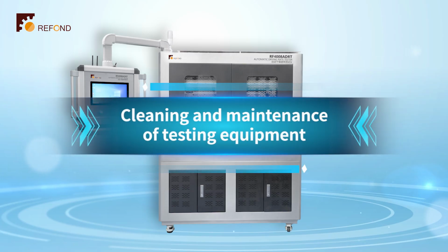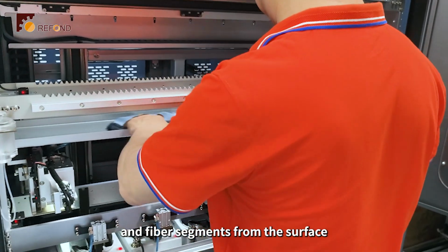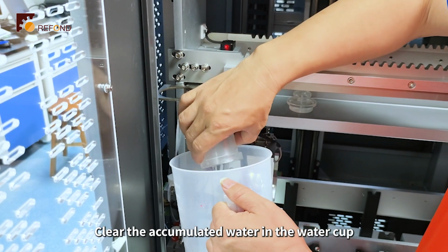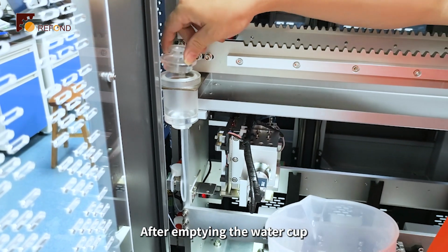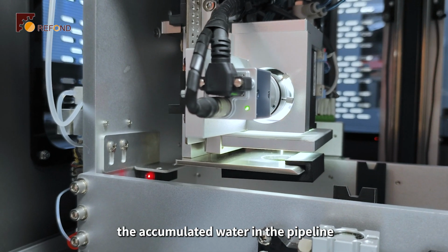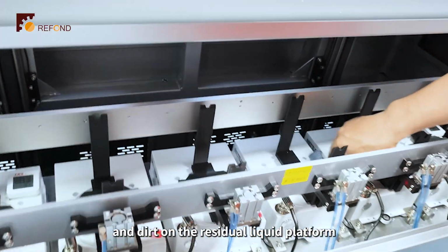Cleaning and maintenance of testing equipment. Regularly remove dust, sample fragments, and fiber segments from the surface of the balance. Clear the accumulated water in the water cup in a timely manner to prevent the formation of scale. After emptying the water cup, click on the exhaust button to drain the accumulated water in the pipeline. Timely clean up the accumulated water and dirt on the residual liquid platform.